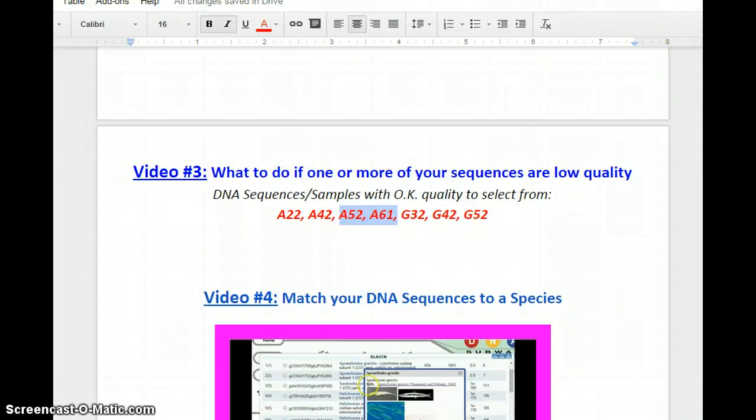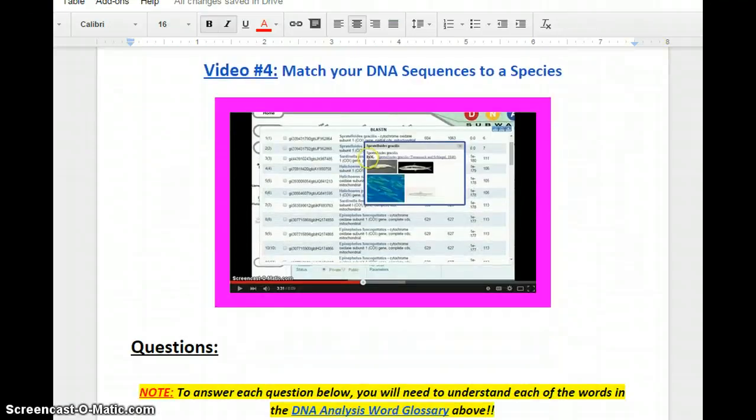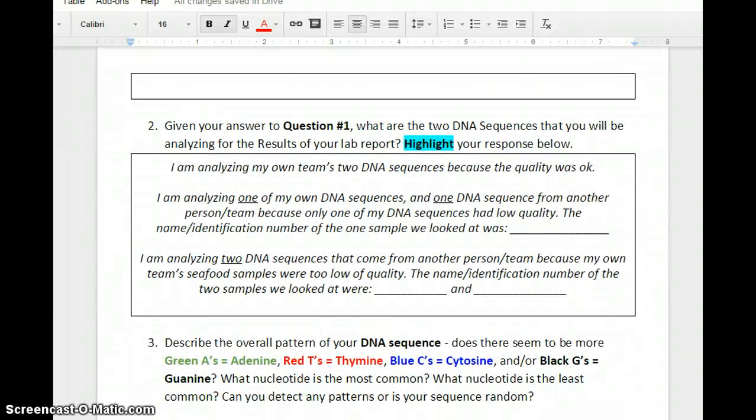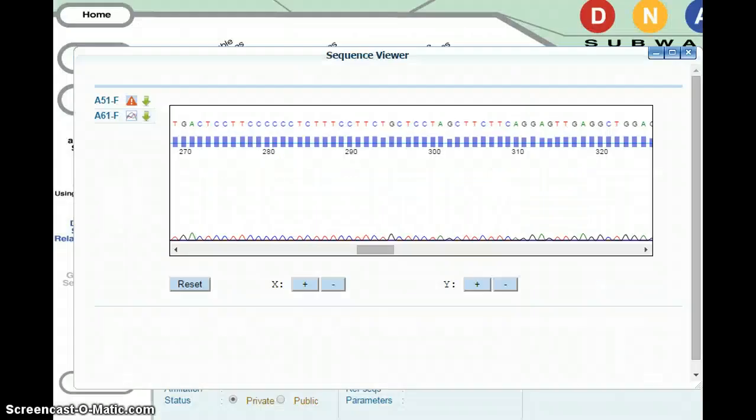When answering your questions in step 7, you just want to make sure that you are now looking at, note that you're looking at Section A, Team 6, Sample 1, Section A, Team 5, Sample 1. You want to note that you're looking at these samples now rather than your own.